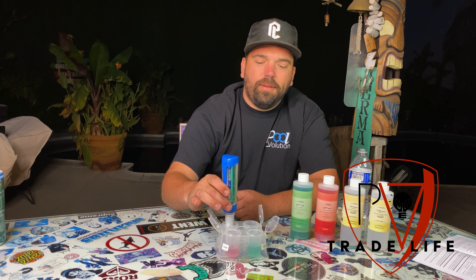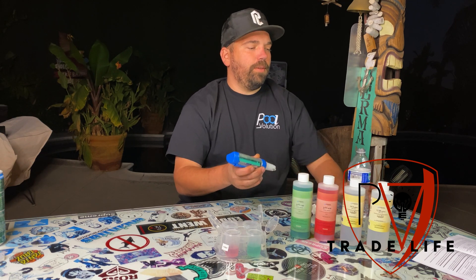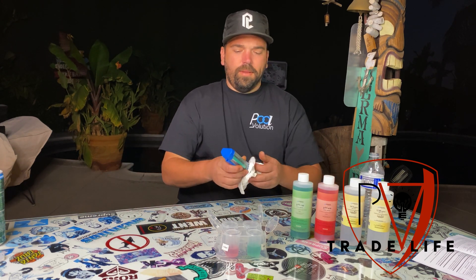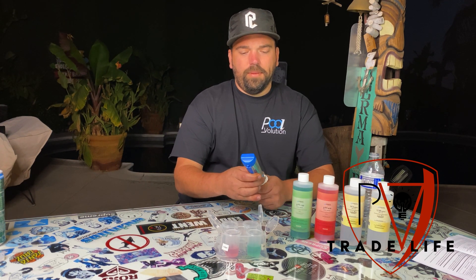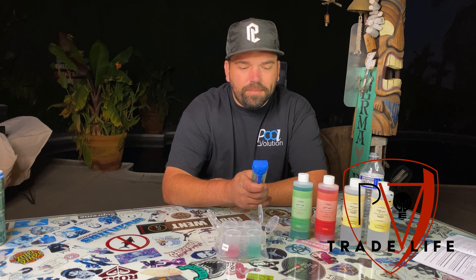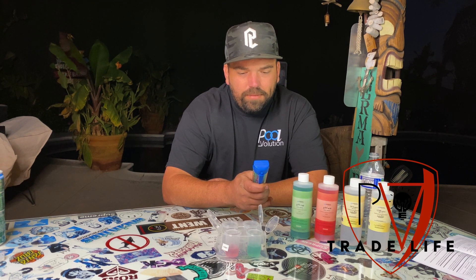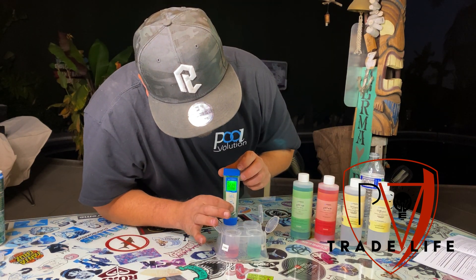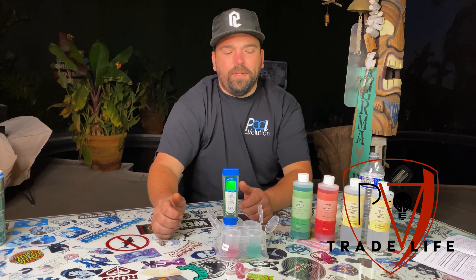We're going to do it anyway for this video. Rinse it off — use distilled water, please. We're still in conductivity mode. Hold the calibration button down again and it's going to ask for the 1288. Dip it in the 1288 solution, wait for the happy face, hit enter, and that's the calibration for salinity. If you want to do the two-point conductivity calibration, that's how you do it.